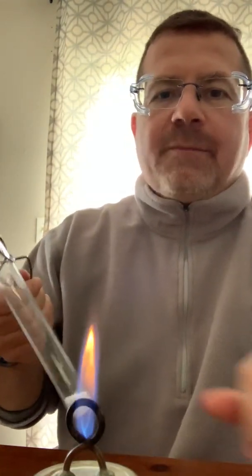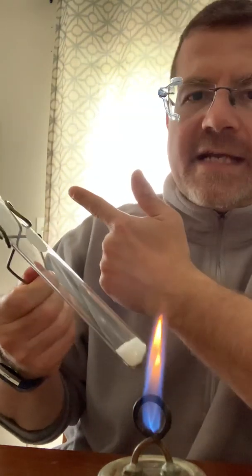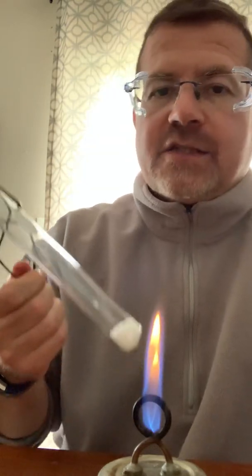My students, you get to see this cool demonstration because we balanced the decomposition reaction of potassium chlorate — we just balanced that, hopefully that made sense. But I just thought you earned the right to see this reaction because it's a really cool reaction. I've got eye protection on. I would not do this demonstration without eye protection. I'm also going to take this tool right here, which is going to enable me to hold the test tube in a way that hopefully you'll be able to see. I'm also going to point the test tube away from me.